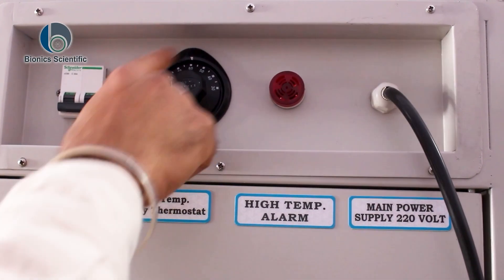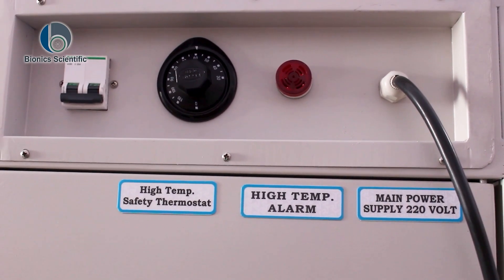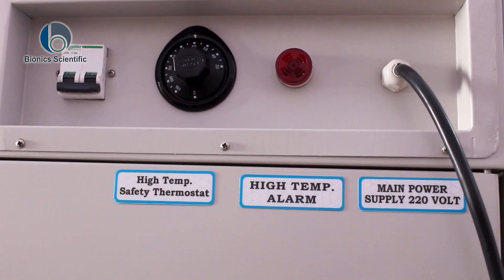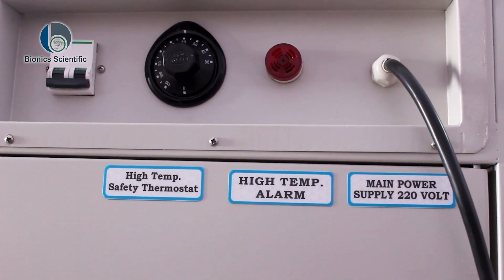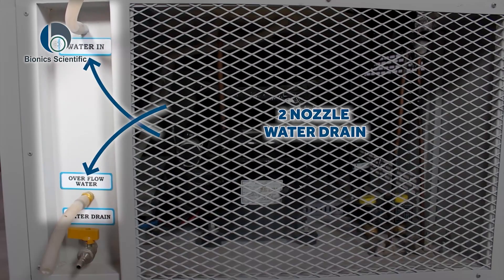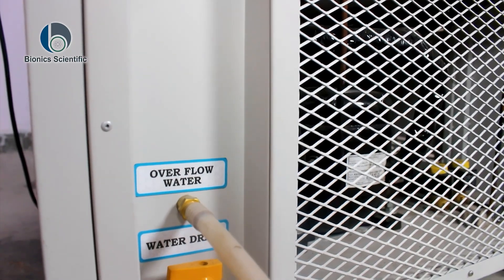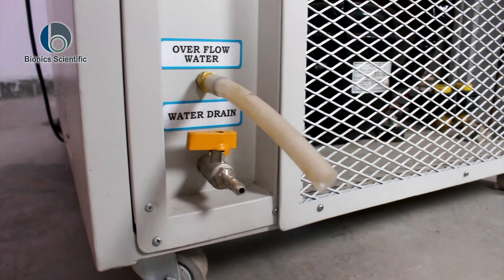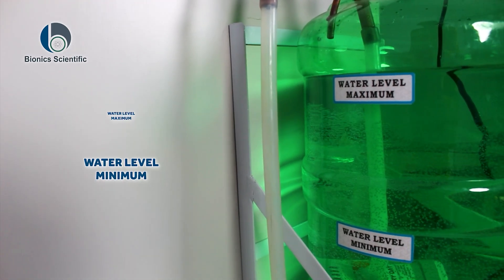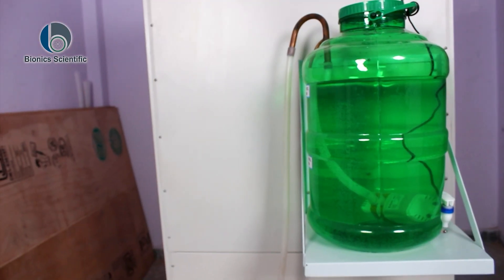As you can see here, it is written: 'High temperature safety thermostat.' What does the safety thermostat do? It always ensures that whenever the temperature rises, the machine doesn't go haywire — so the machine behaves in a proper manner. There are also two nozzles present here for water draining. If the chamber contains surplus water, these two provisions allow it to be drained out. There are two stickers indicating water level maximum and water level minimum — you need to fill the container accordingly to maintain humidity inside the chamber.